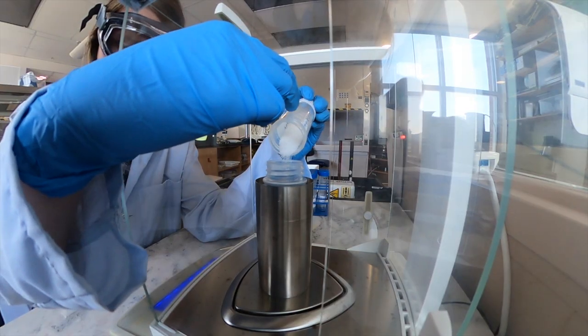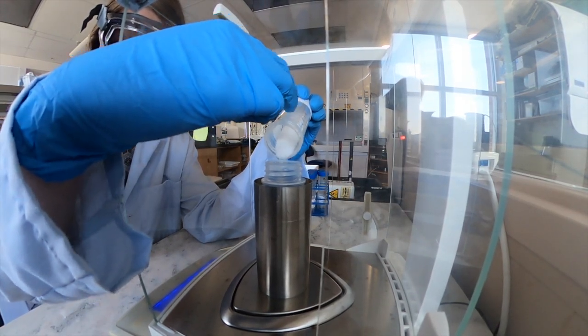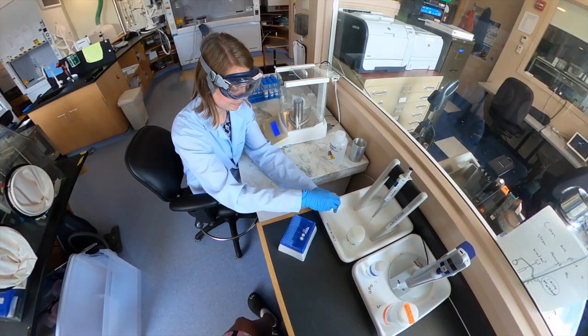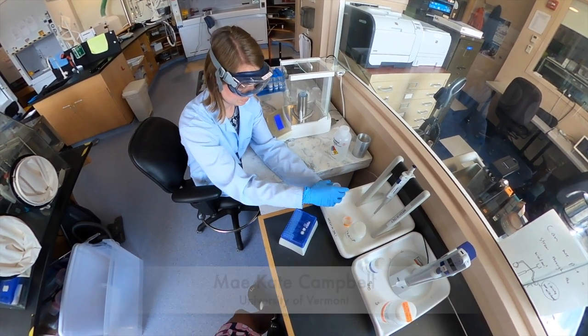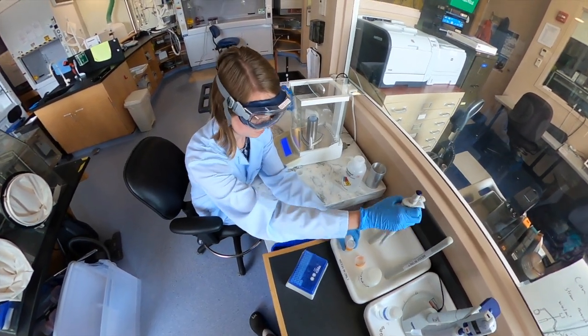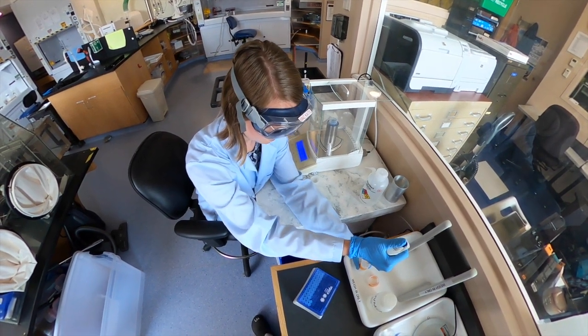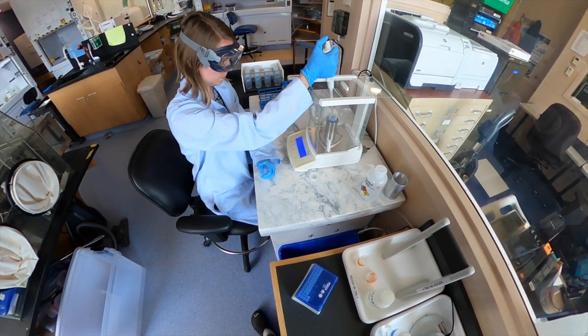So we start with clean quartz, that is quartz that's typically under 100 parts per million of impurities, and we usually use between 10 and 40 grams of that quartz. We add to that quartz carriers, and carriers are predominantly the isotope beryllium-9, the stable isotope of beryllium, and the isotope aluminum-27, the stable isotope of aluminum. We add carrier to do what's called an isotope dilution experiment.